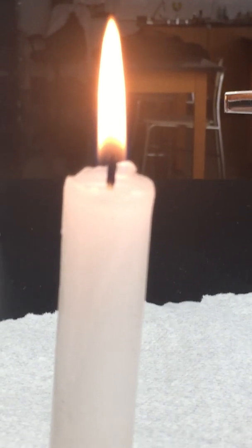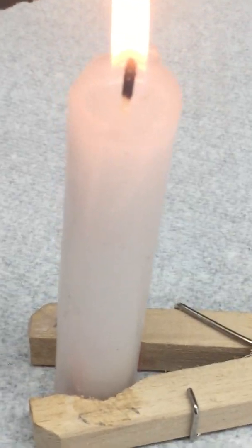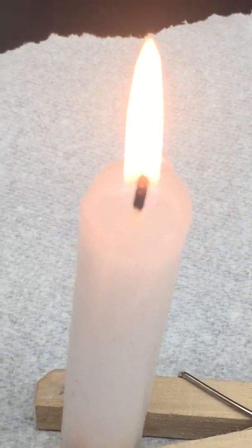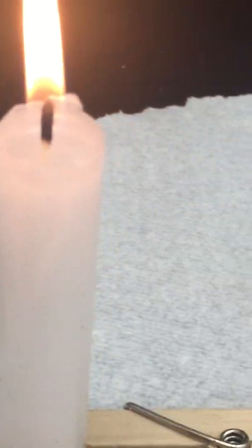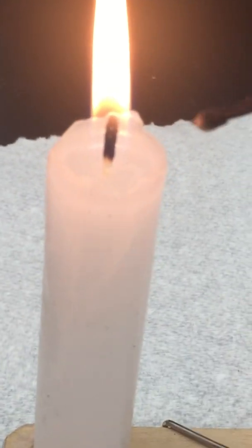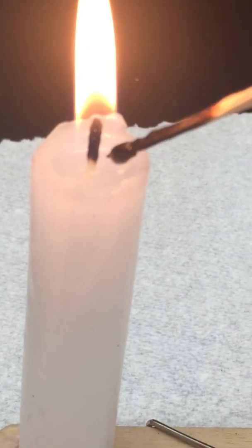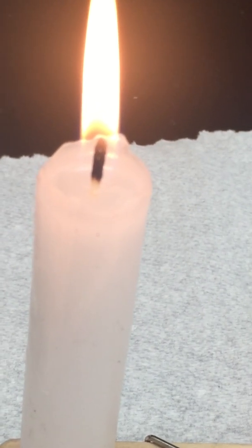Okay, so you're making observations during, right? You've got to have 6 during. I'll poke and prod at it so you can make some kind of observation. Should be able to see that.